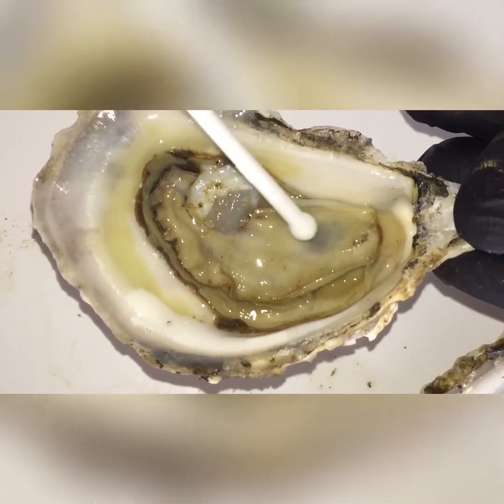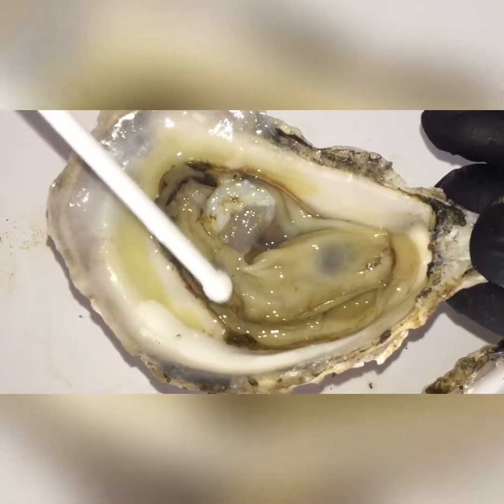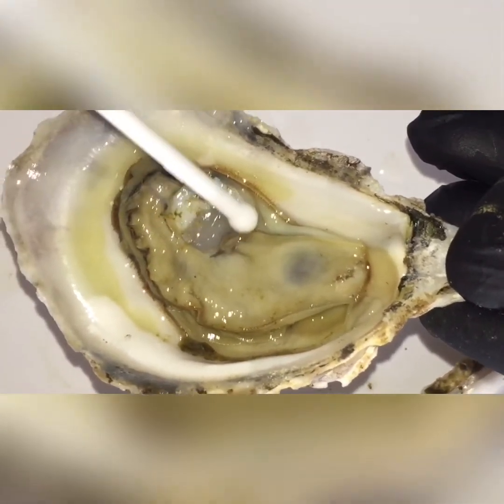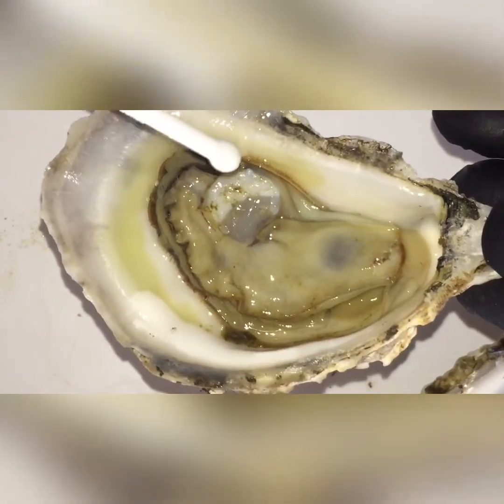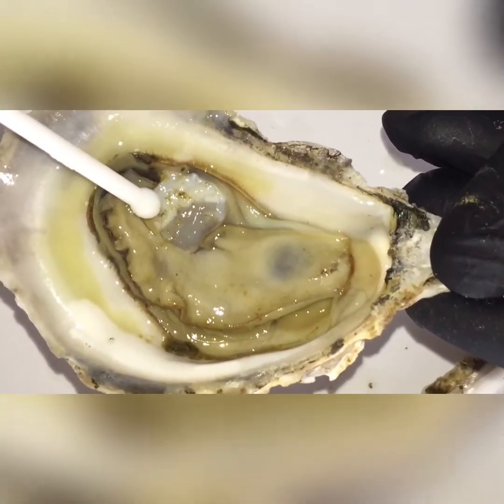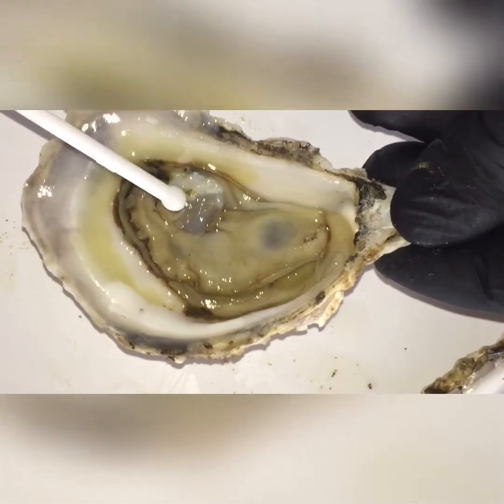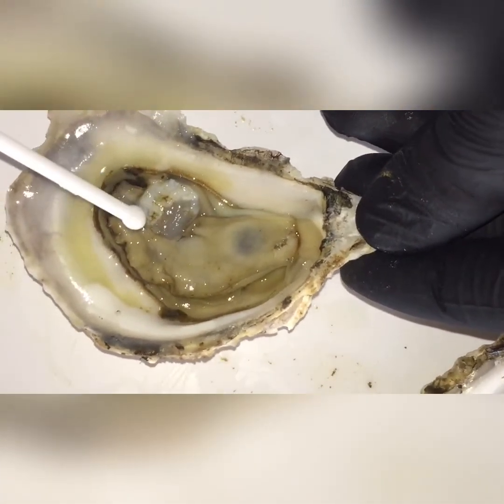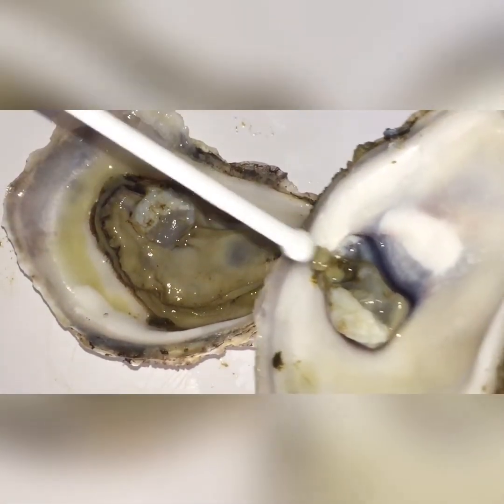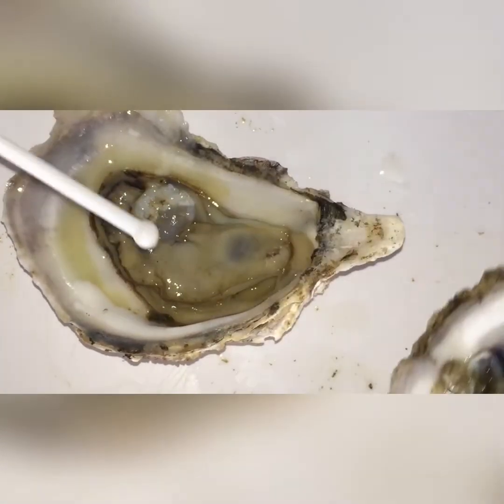So we have the stomach here. And then in between the stomach and the adductor muscle lies the heart. The oyster has a small heart — it's kind of hard to see, but the heart's right in here. Sometimes if you shuck a fresh oyster, you can see the heart still beating, which is pretty interesting. And this right here is the adductor muscle — it's very tender. That allows the oyster to close its shell very tight. When you shuck an oyster, you have to slice the adductor muscle because they are attached. This is the top part of the adductor muscle.